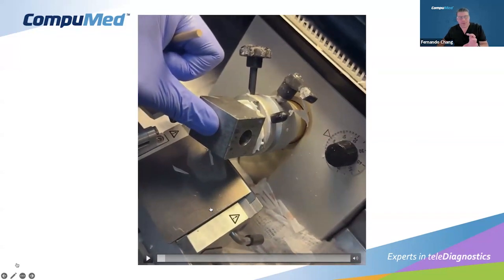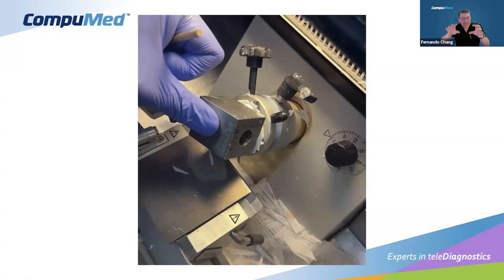Now in this one, I want to show you how this chuck was placed in the cryostat, but it was not at enough temperature because we plaster the chuck. Sometimes the tissue and the OCT leave a space because they don't connect immediately at the flat level of the embedding plate. And the temperatures might be different. The OCT temperature is different. That's why we recommend a pre-chilled OCT. It's extremely important. But in this case, we didn't have pre-chilled OCT. We ran out of it in the fridge, and we only had room-temperature OCT available.